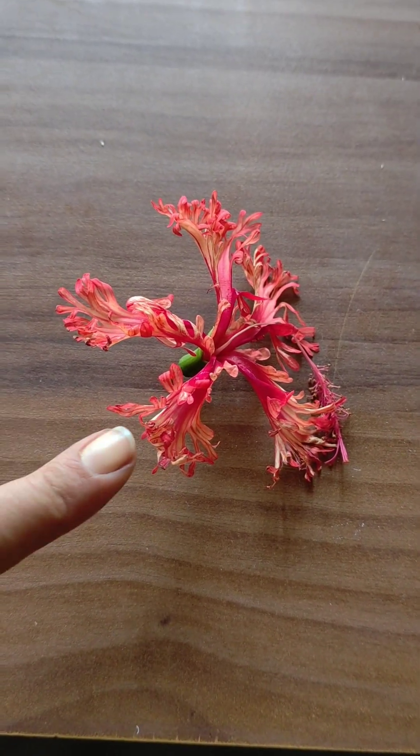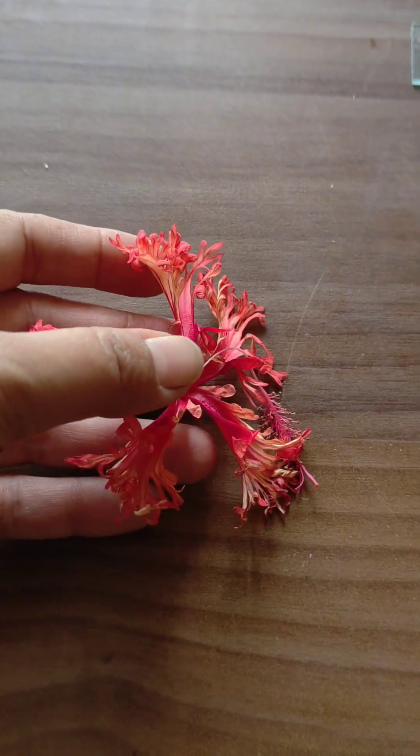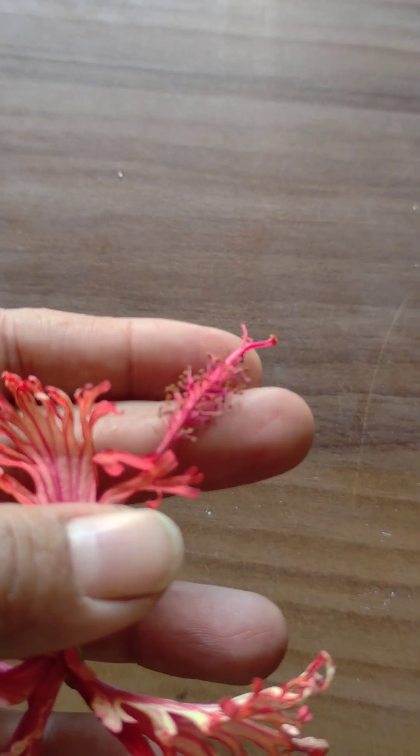For this experiment, I chose a hibiscus plant with their male reproductive part.